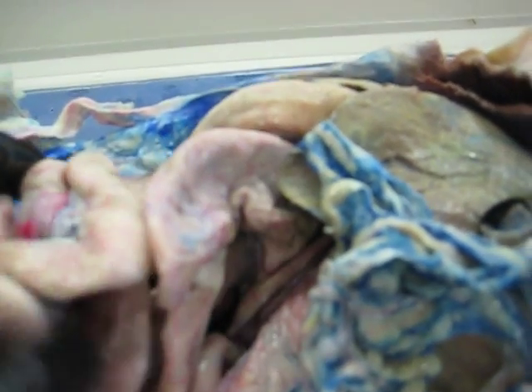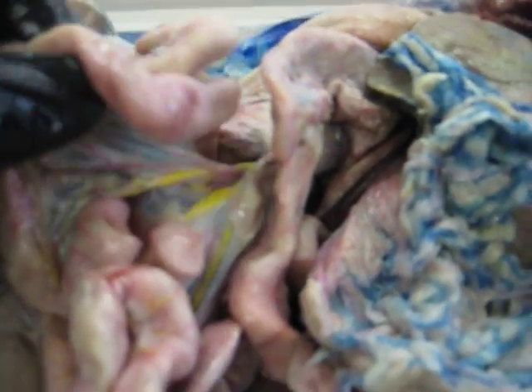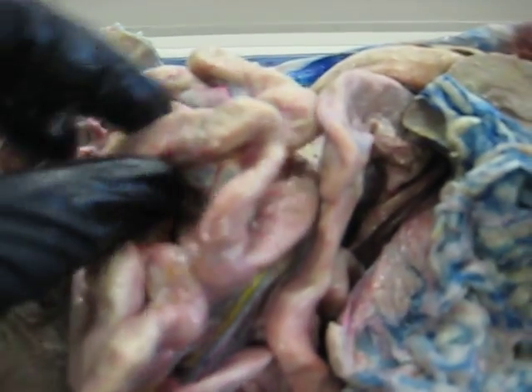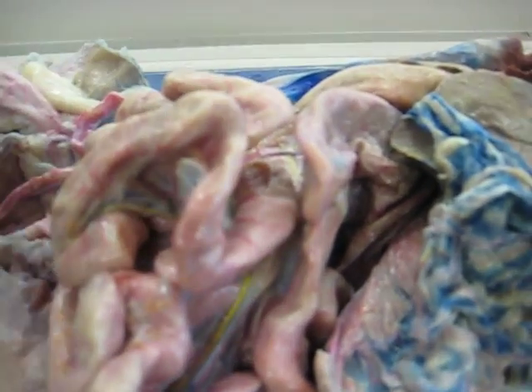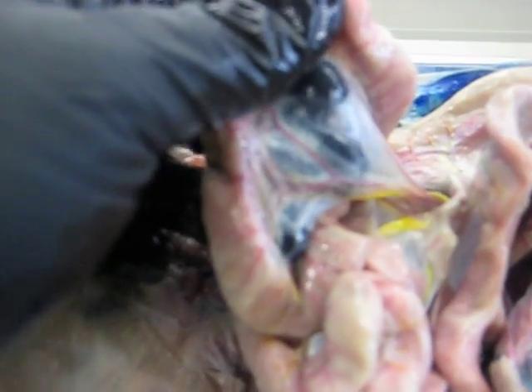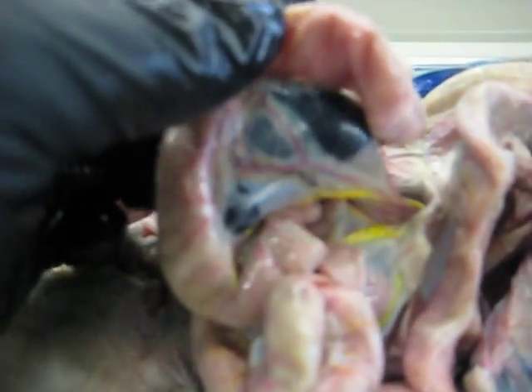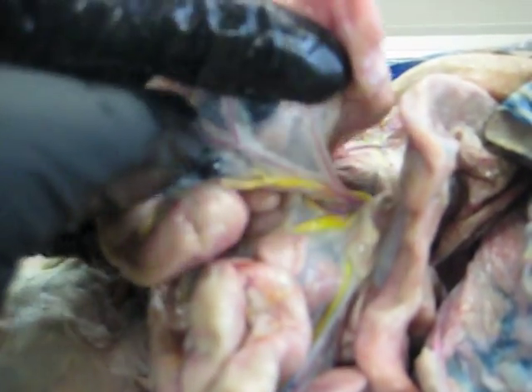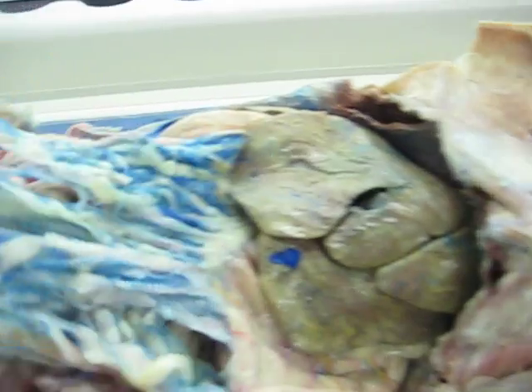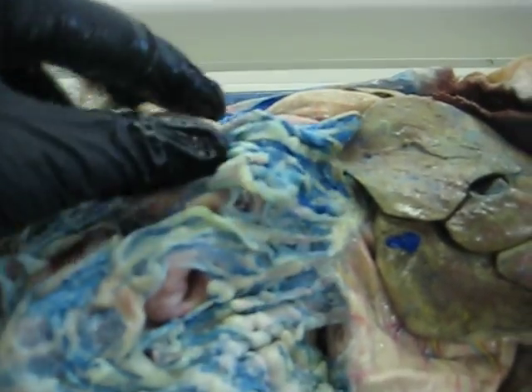And last but not least, you have the mesentery. The mesentery suspends the ileum and the jejunum from the posterior wall of the abdominal cavity. The mesentery is quite predominant throughout the intestine, but to give you a brief example, it is this fine little webbing right here, which holds all your mesenteric vessels. And that, in a nutshell, is the abdominal viscera of the domesticated cat.